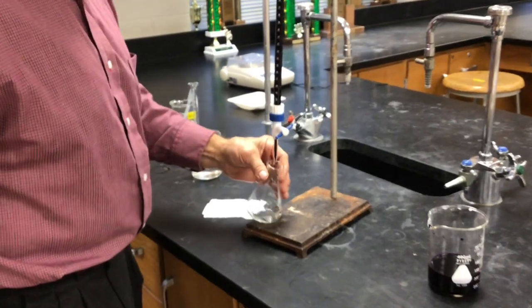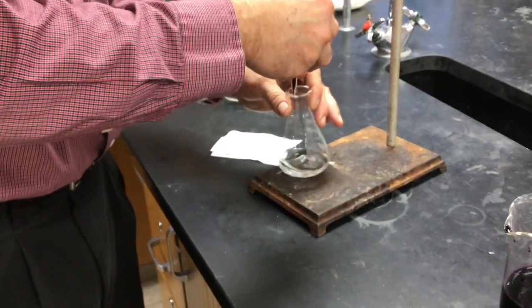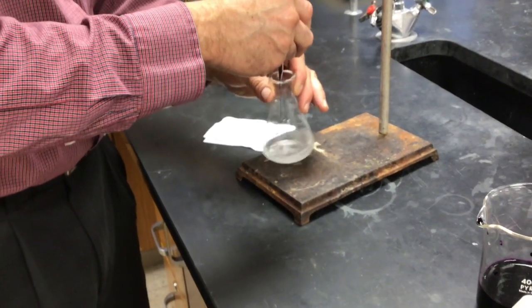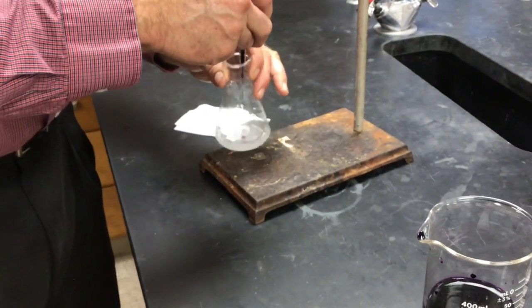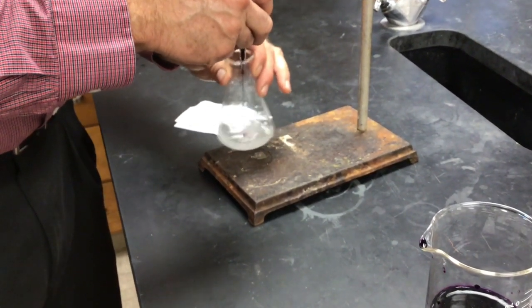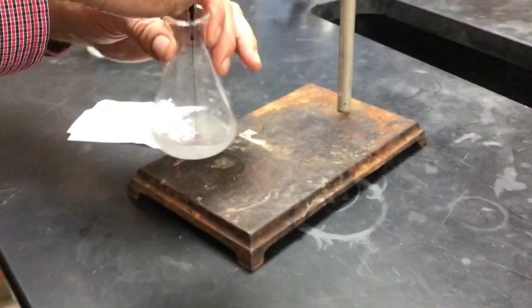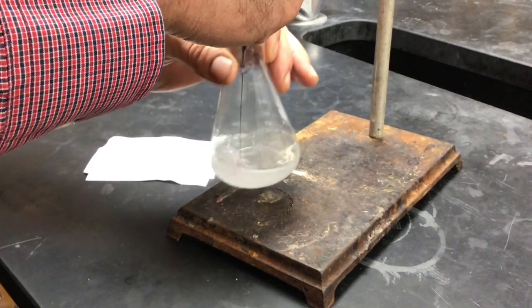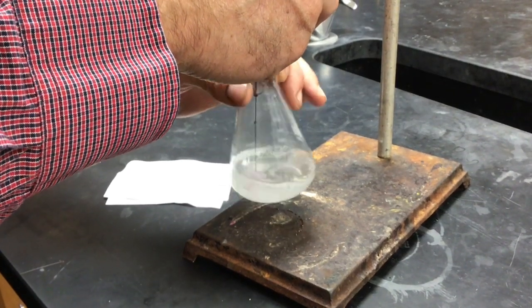So we should be able to take it down pretty close to 46, right? It's always amusing in class when students forget to acidify the peroxide, because then you never get the color change.